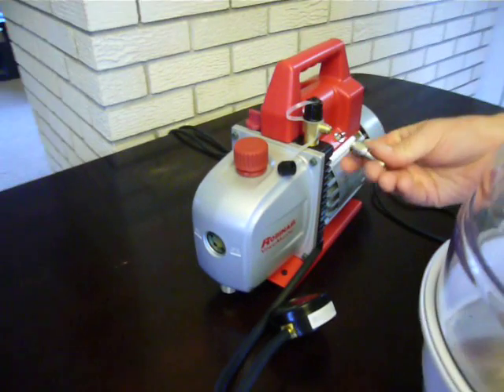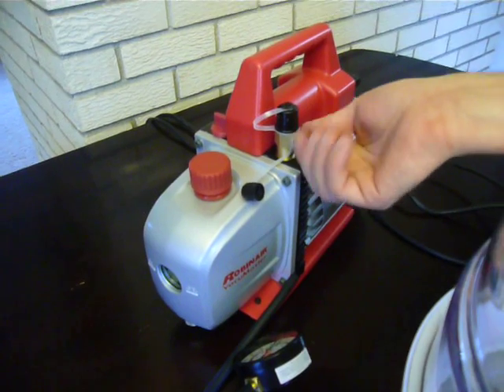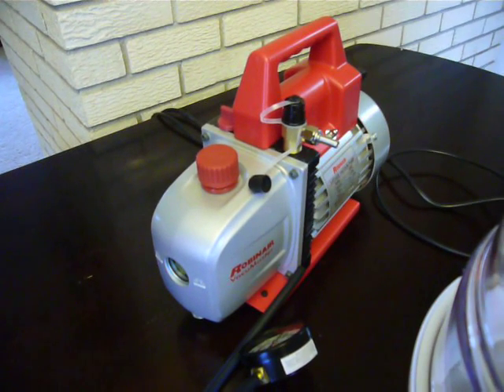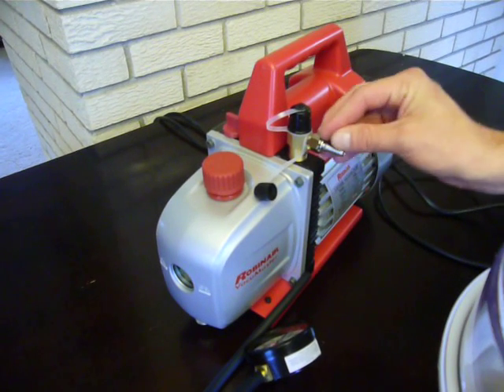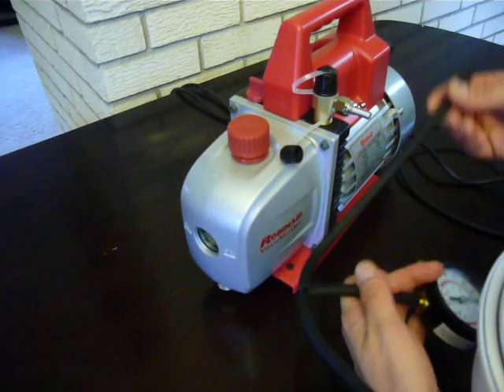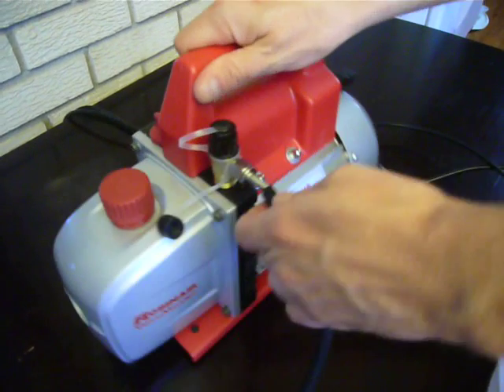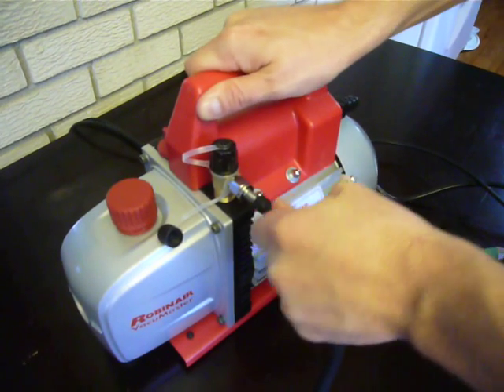The next step is to attach the pump fitting directly to the pump. Screw it on and use pliers to tighten it just so it's comfortably snug — it doesn't have to be cranked on. The flare fittings are designed to be airtight against pressure without any need for plumber's tape or Teflon tape, so that's unnecessary for this application. Then go ahead and take the other end of your hose and gauge kit and pop it on there.